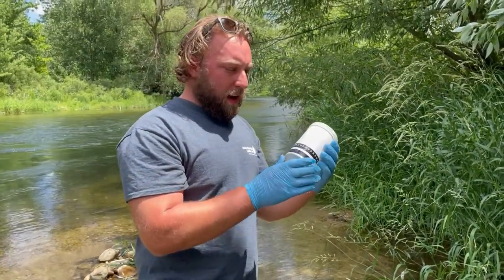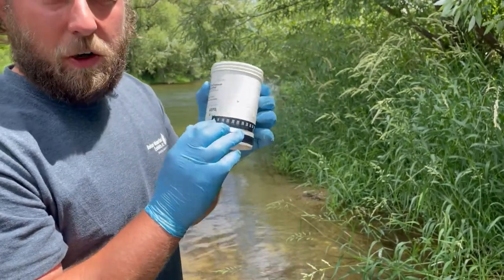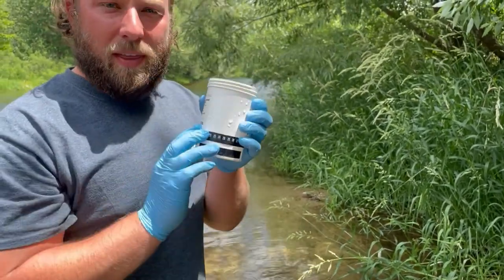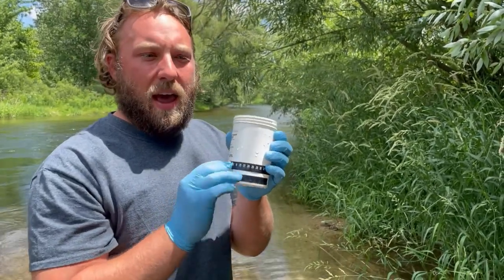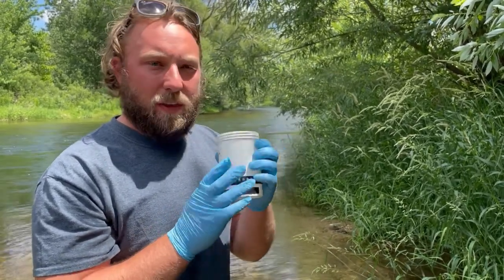All right, so now that I've held this for 1 minute, you'll see that the 16 degrees Celsius here has turned blue. That means my temperature measurement is 16 degrees Celsius. And we'll record that. We'll do it 3 times so that we have triplicates, and then we'll check and see, is that a healthy temperature for this time of season for the trout that live in the Boise River?